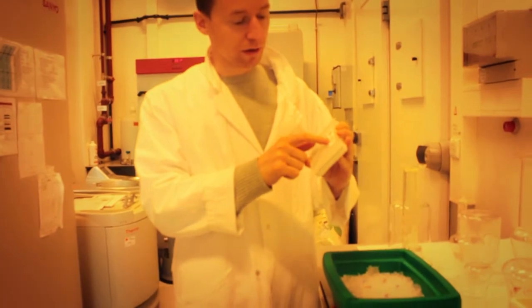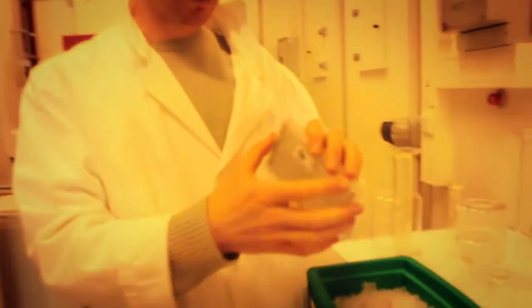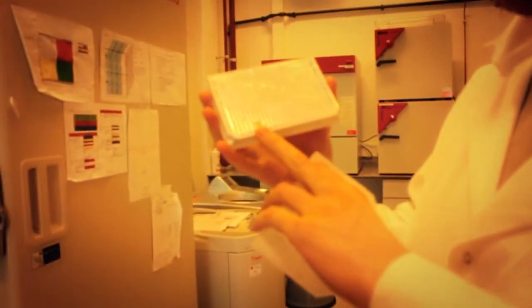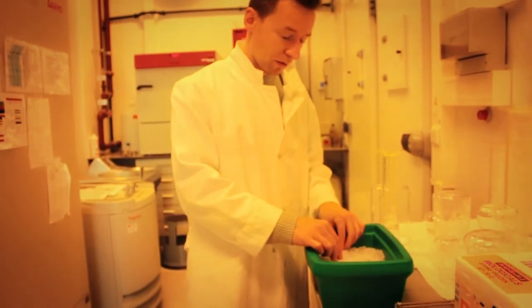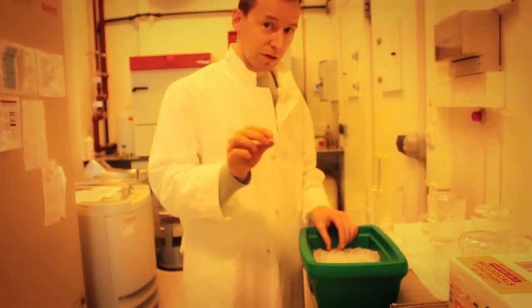So this is the Spring 2011 DNA distribution plate and the plasmid, the RFP construct we're going to use is 6-0. So I'm going to take one microliter of this and put one microliter in each of these tubes.